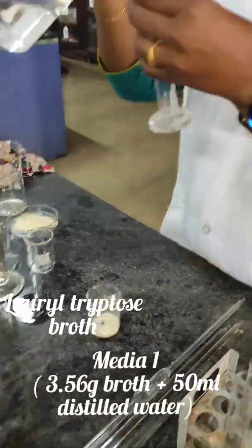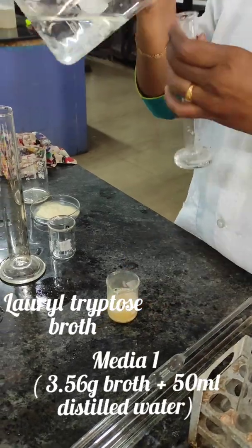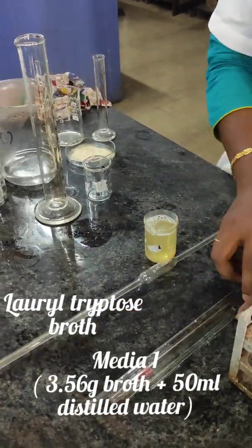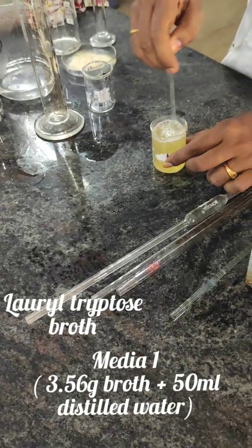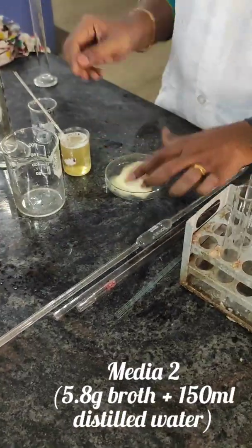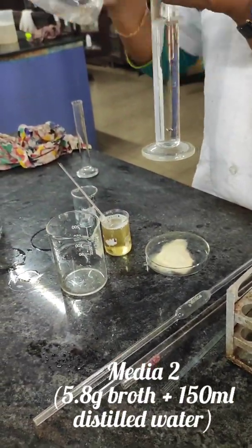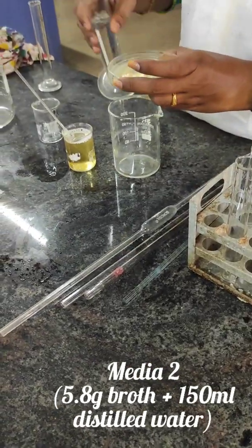To prepare media, we need lauryl tryptose broth. Media 1 can be prepared by dissolving 3.56 grams of broth in 50 ml distilled water. Then Media 2 is prepared by dissolving 5.8 grams of broth in 150 ml distilled water.